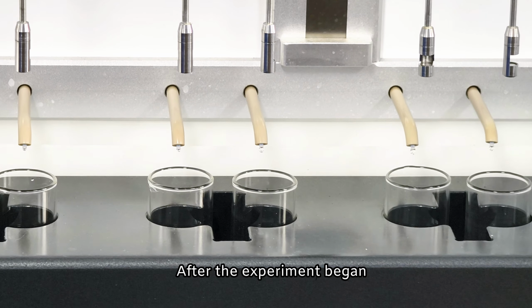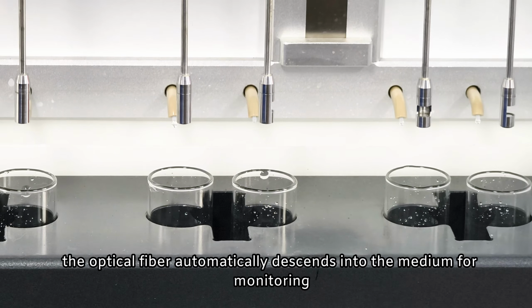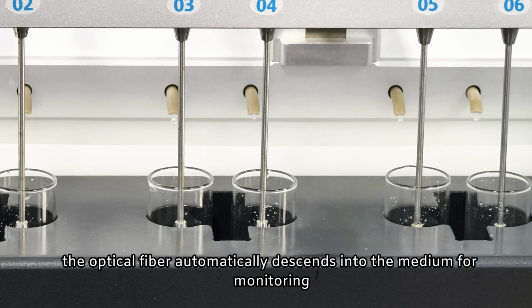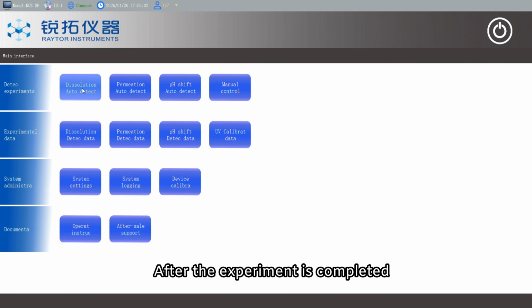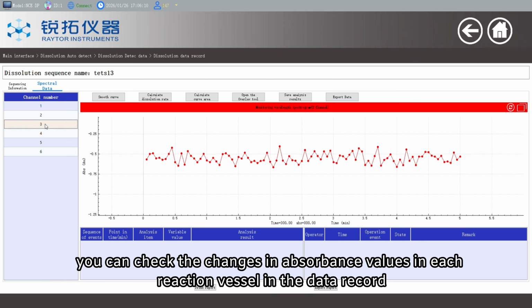After the experiment began, the liquid injection needle automatically emptied the pipeline and added a certain volume of medium to the reaction vessel. After the liquid is added, the optical fiber automatically descends into the medium for monitoring. The interface records the changes in absorbance values in the solution in real time. After the experiment is completed, you can check the changes in absorbance values in each reaction vessel in the data record.